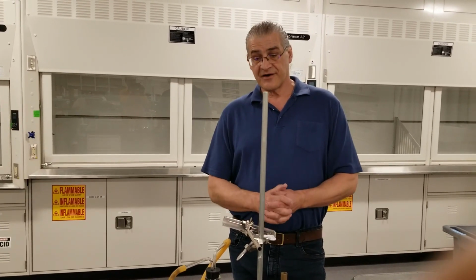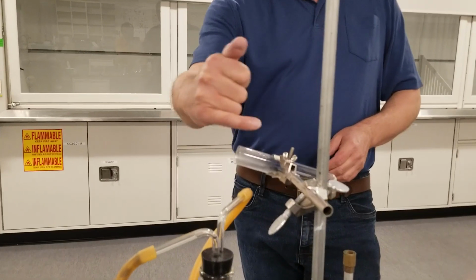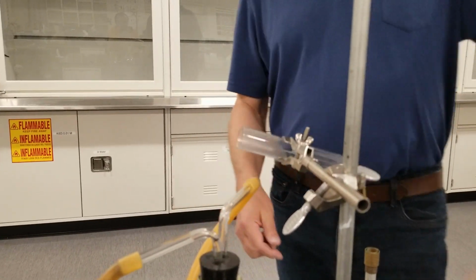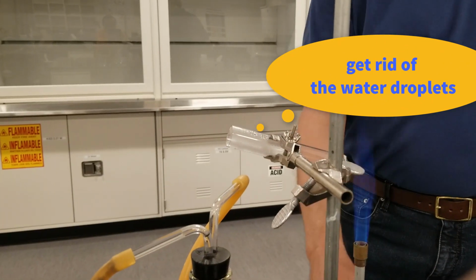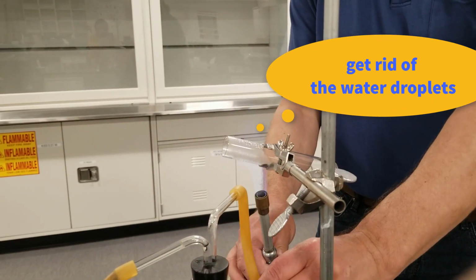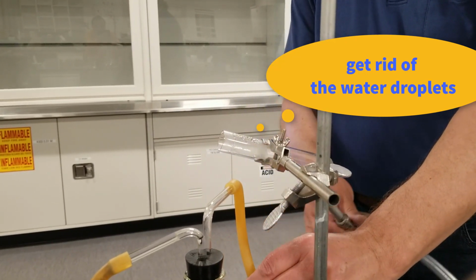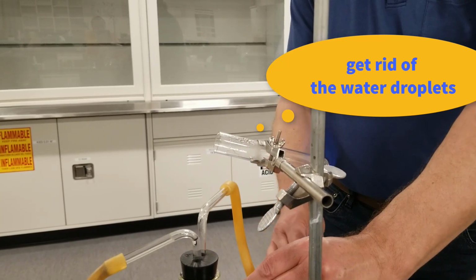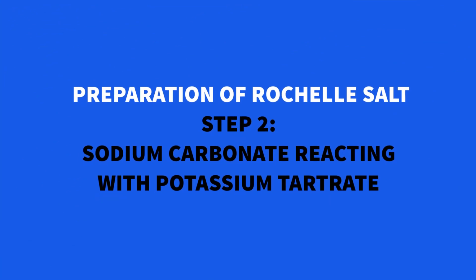Now the reaction's done, but you see water droplets at the mouth of the reaction vessel here. So to get rid of those water droplets, you would simply heat it up, and that water should disappear on us. And that's the first part of the experiment, making the sodium carbonate.